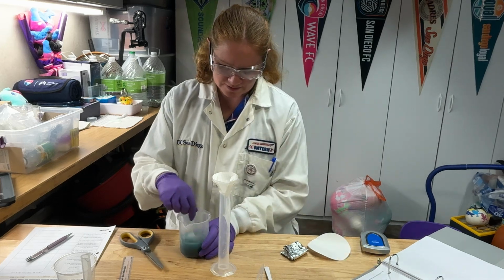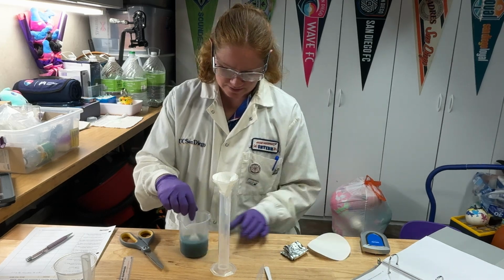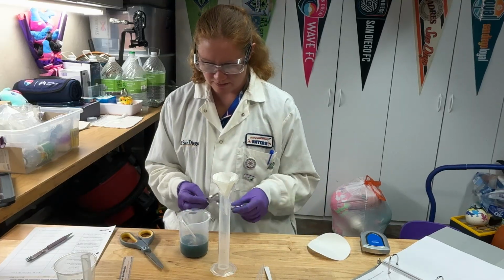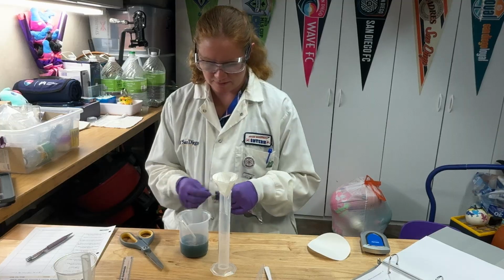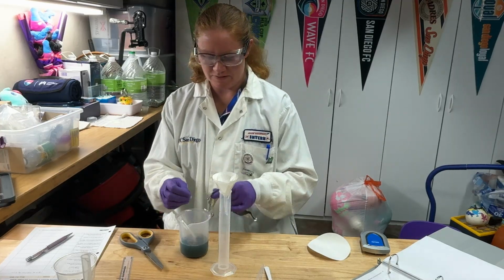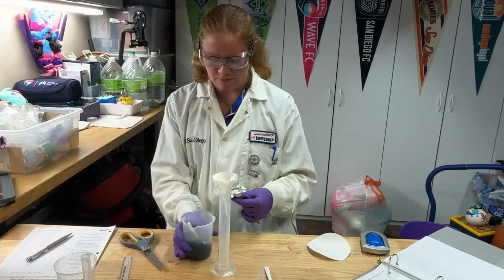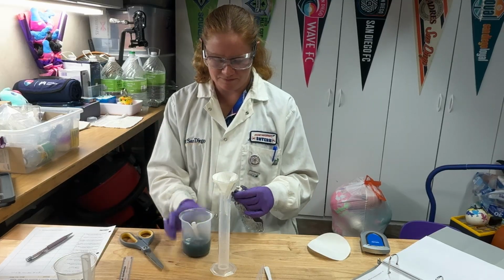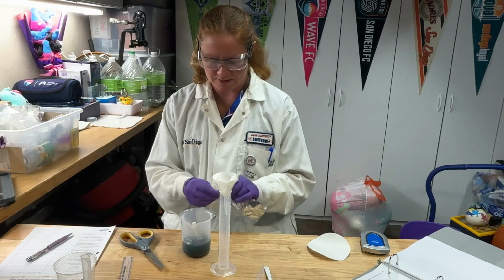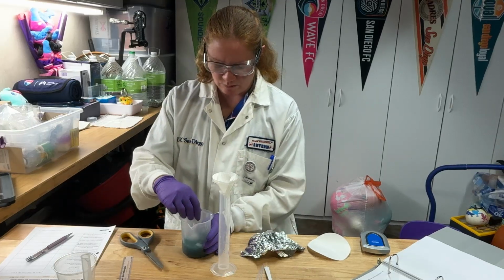Because you'll want this, like I said, to be completely reacted. Let me see if I can get more of it to react. Oh, I'm getting some good steam there. This is an exothermic reaction, so if you add a lot of the aluminum foil and you feel the sides of the beaker, it's going to get fairly warm. All right, let me just go ahead and speed this up a bit. I'll add a whole bunch.